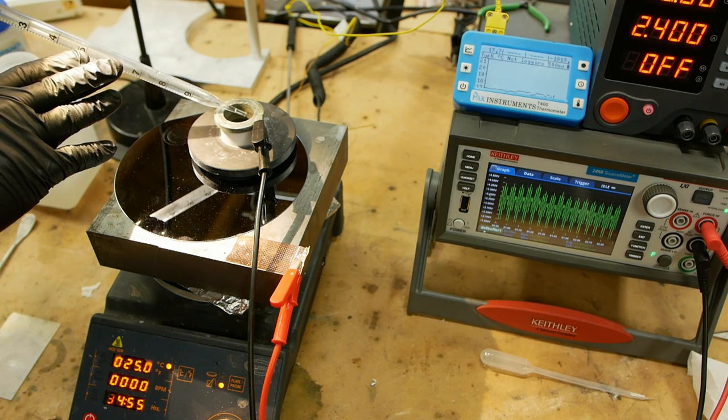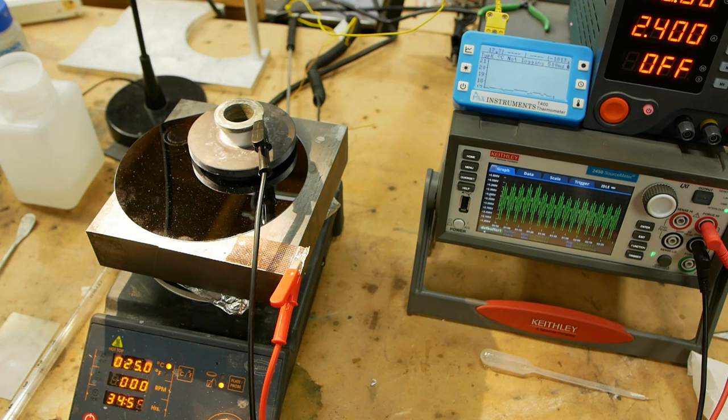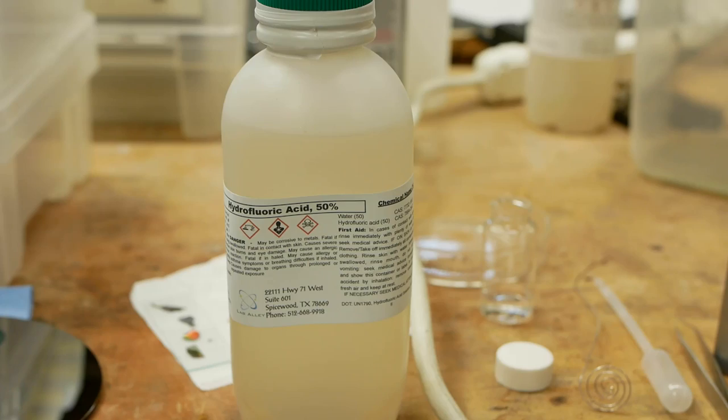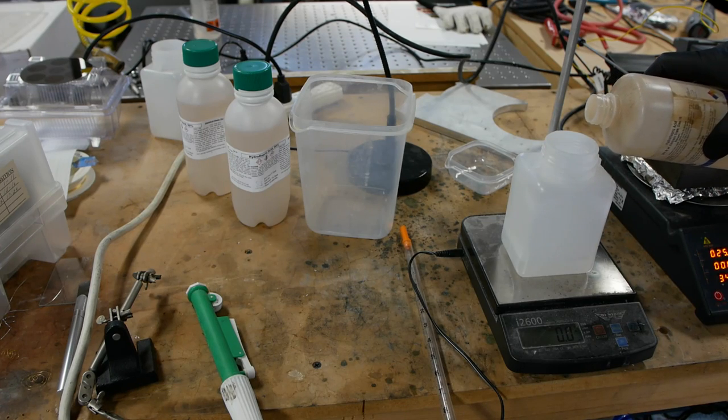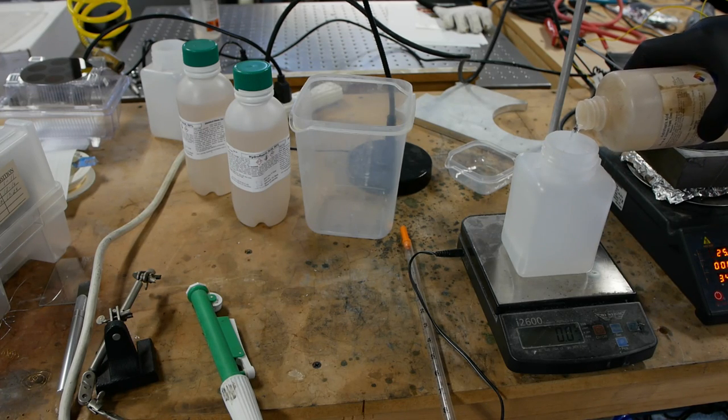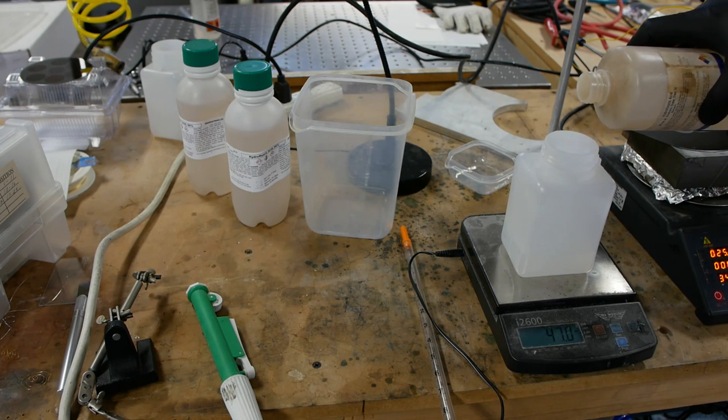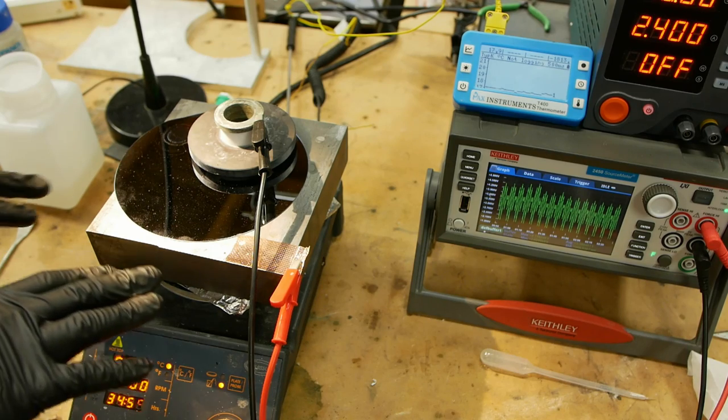I fill up the etch cell with this pipette, with a pipetter. And it takes about 8 ml of etchant. And the etchant that we're using is 50% ethanol and 50% hydrofluoric acid, everyone's favorite. And the acid itself is 50% HF. So of course, it's a very dangerous chemical. The real harm is that it can poison you without causing any immediate pain. So if this is your first time hearing about hydrofluoric acid, you're probably going to want to research chemical safety quite extensively before thinking about using this. It really is a pretty nasty chemical.